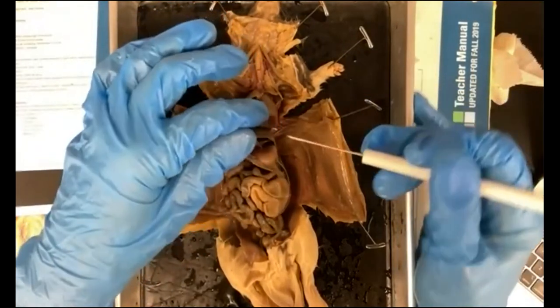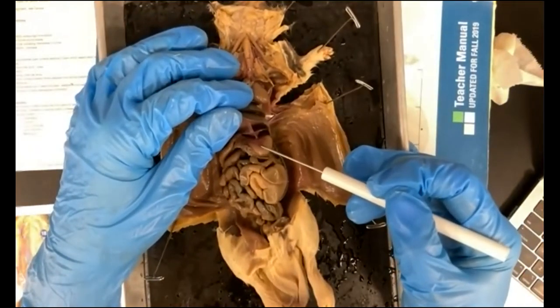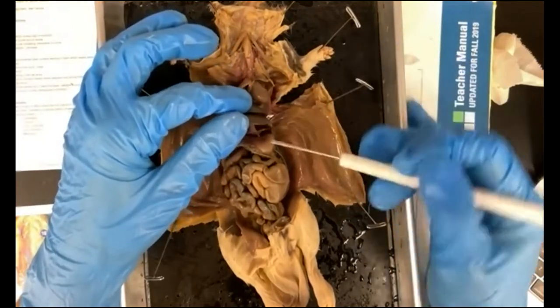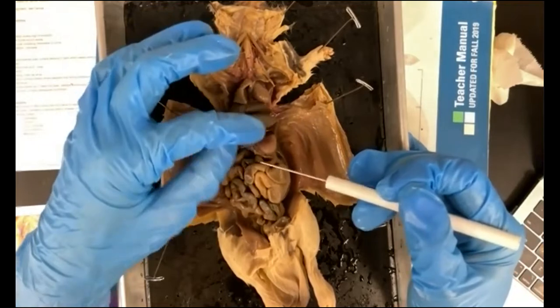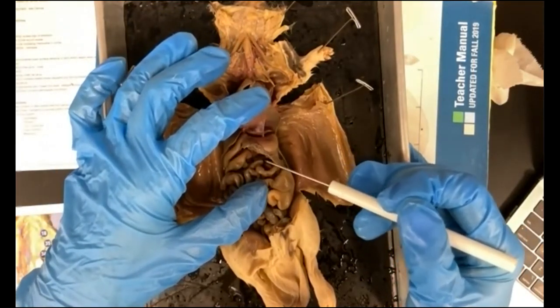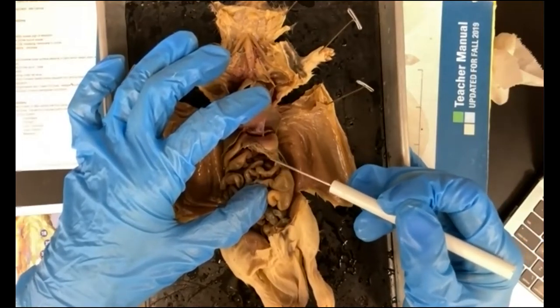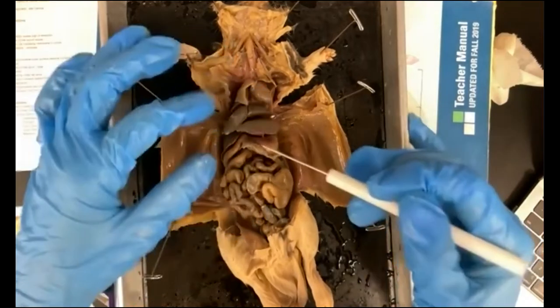And we have to look down here and we're going to find the stomach. Remember that it is under the liver, right? So we've gone from the esophagus down to the stomach, and the spleen is this tissue here. It's very soft, kind of feathery, excuse me, not the spleen, the pancreas. So that's the pancreas that secretes digestive enzymes.